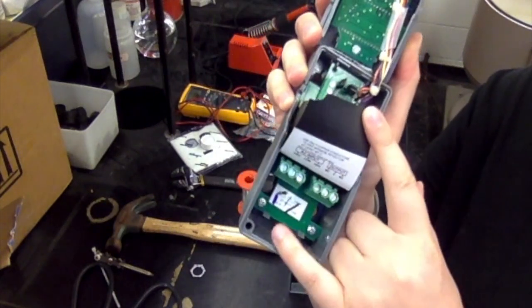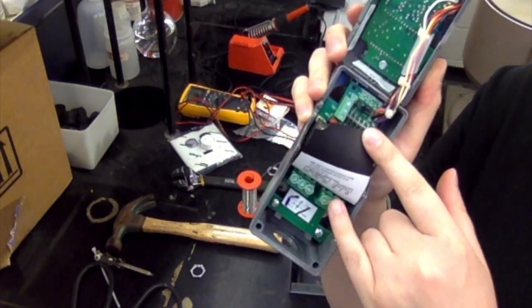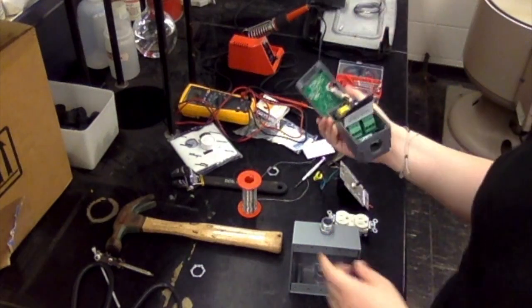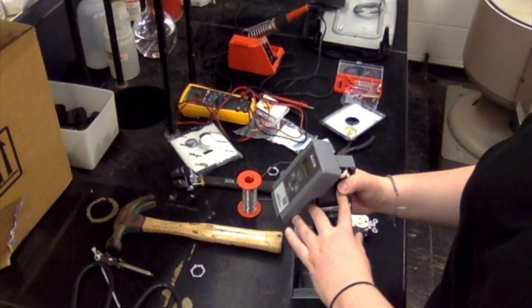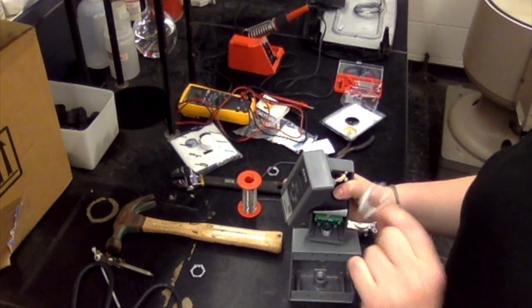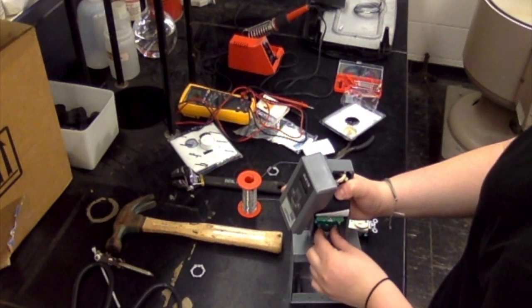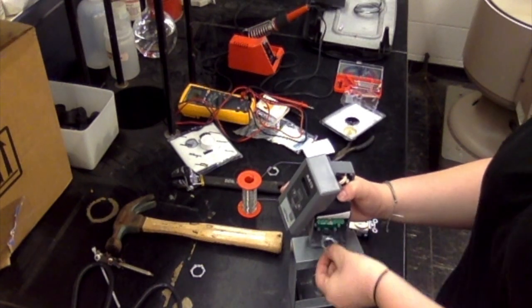If you'll notice, there's a hole in the bottom here, and that's what our connector is going to go to. That's also what all of our wires are going to feed into as well. So you're just going to place this here on the connector, and then you'll take the collar. There it is. The collar, and you're just going to fasten that on there. You'll notice that the collar has tabs on it.